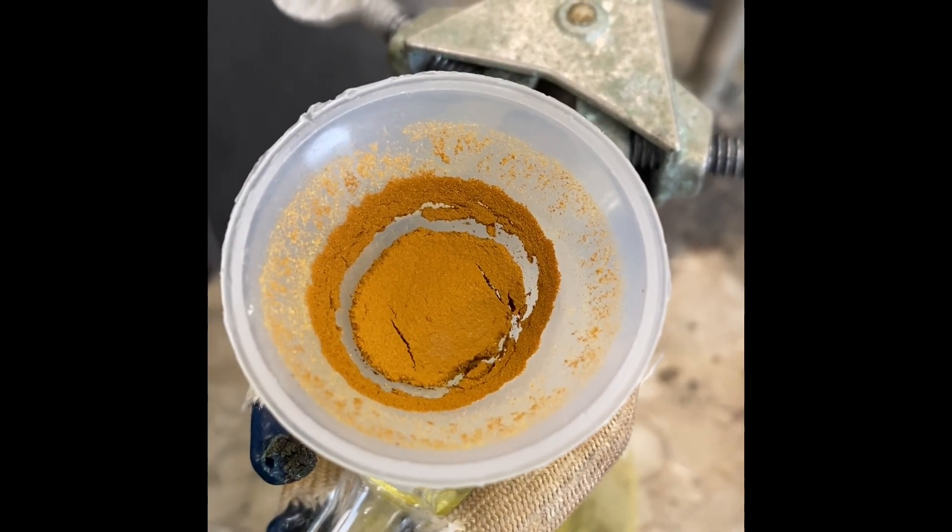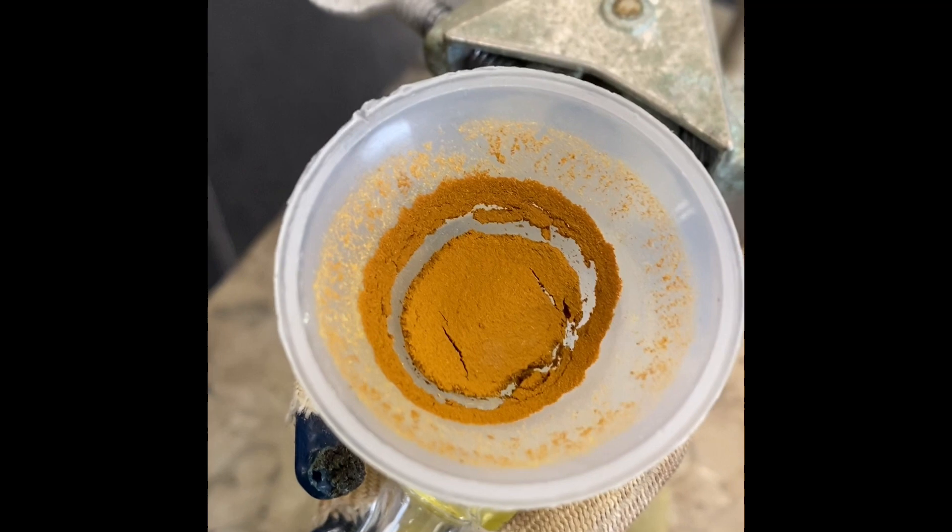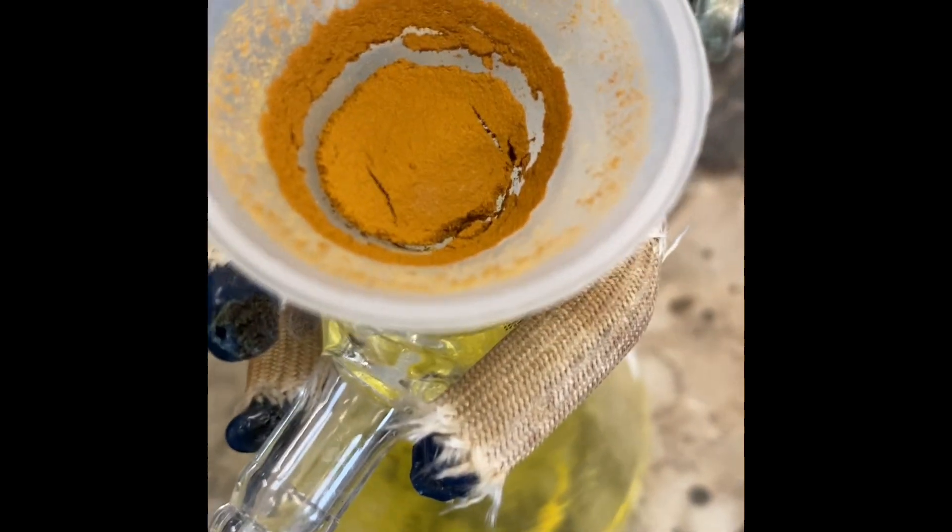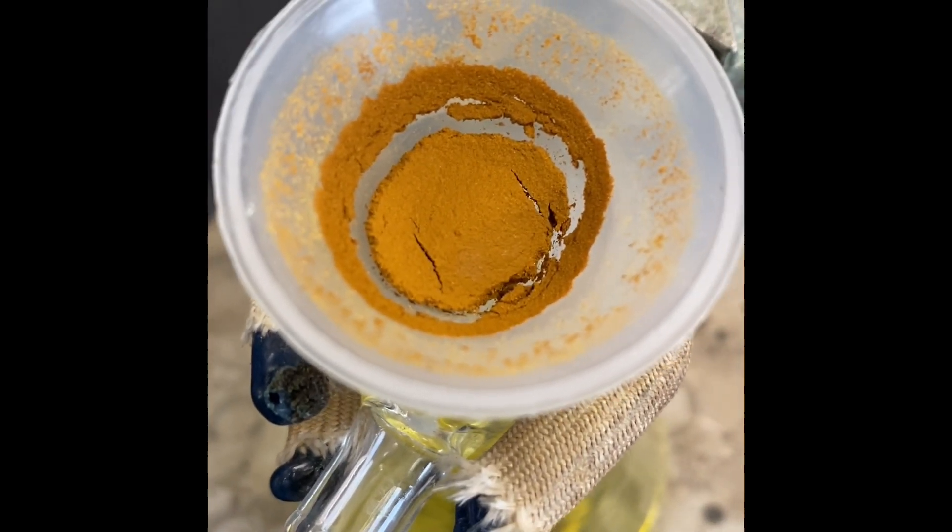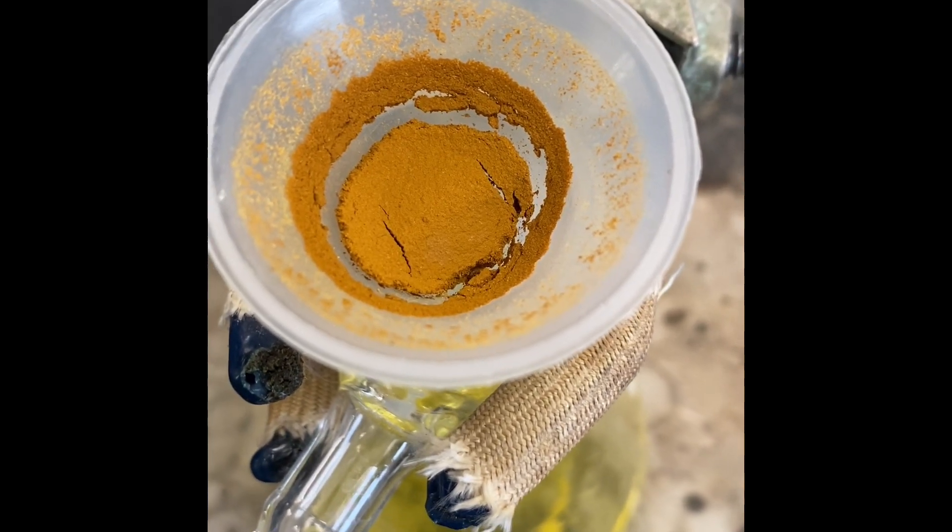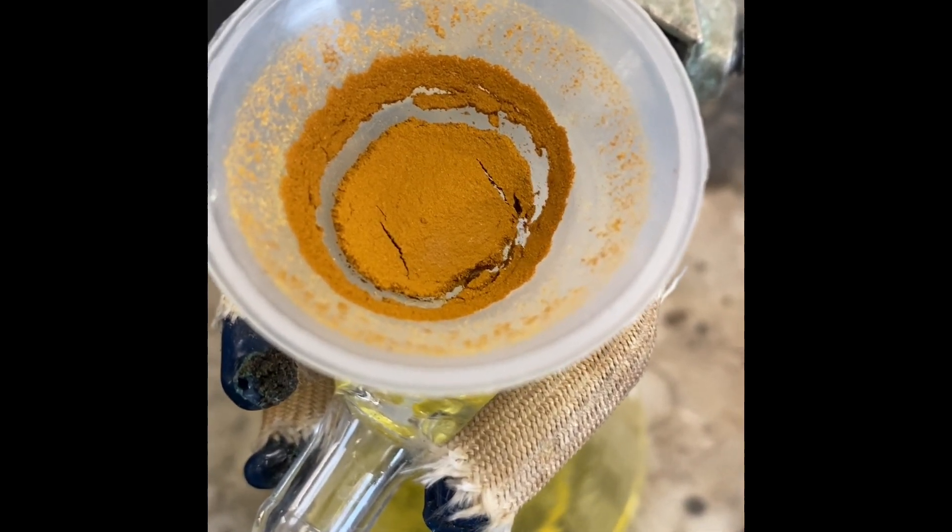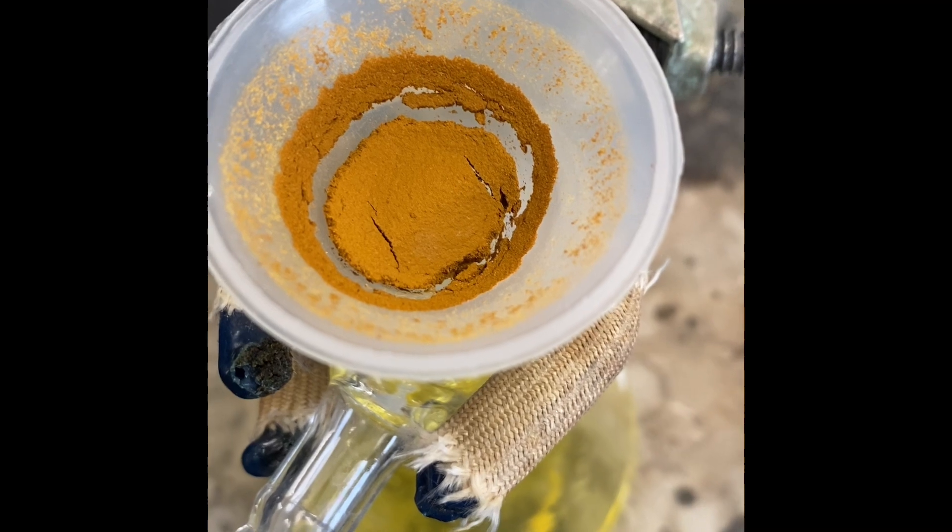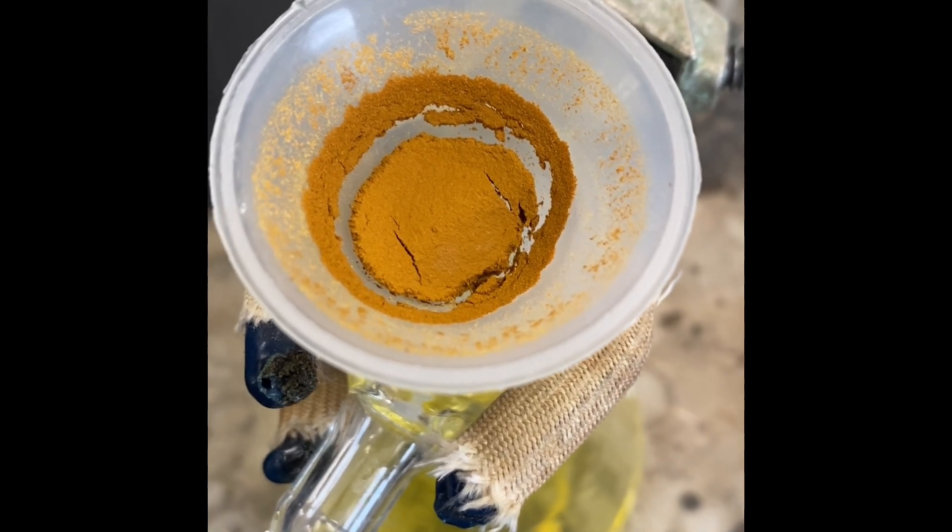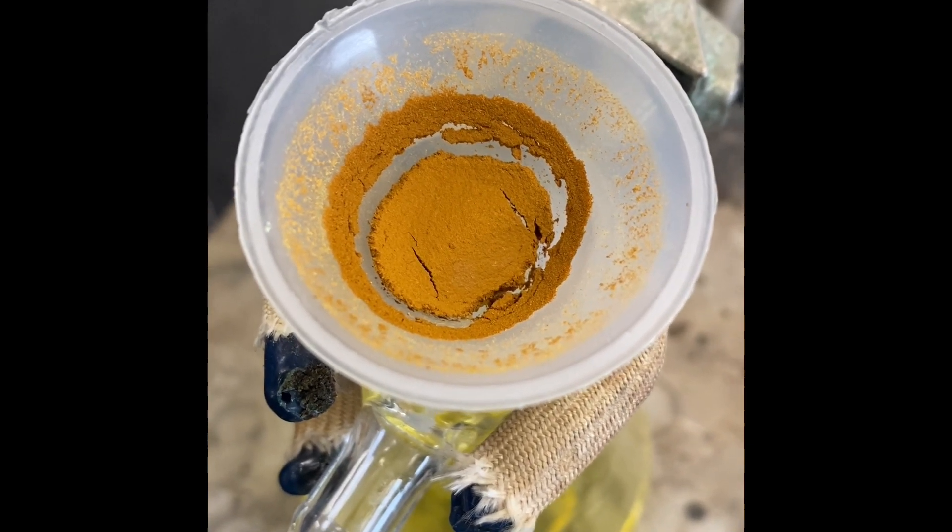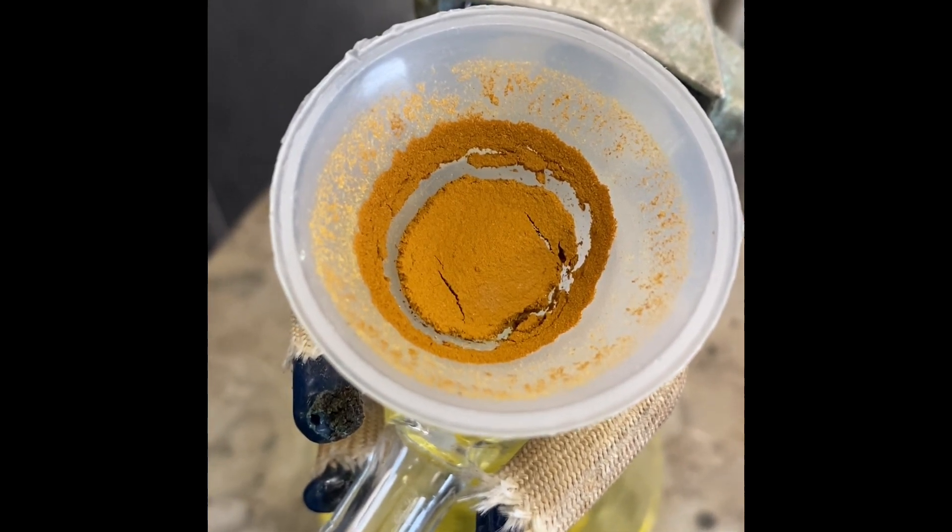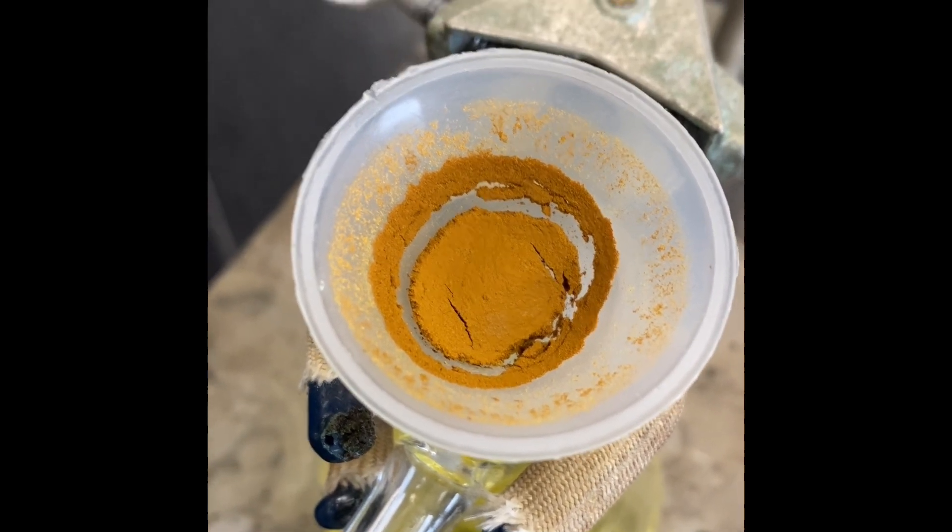After cooling down in the water bath, we did filtration and that's the first reaction product. Now we're going to figure out how much it weighs. It's not dry, but in the textbook it says it should be around 0.7 grams. We're going to use the product for the following reaction.